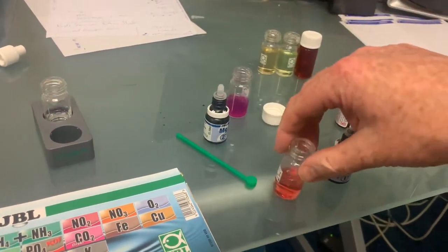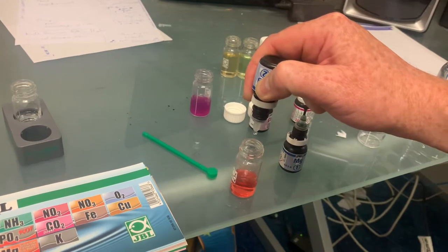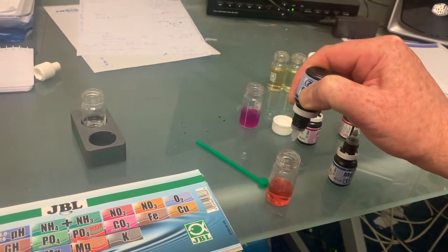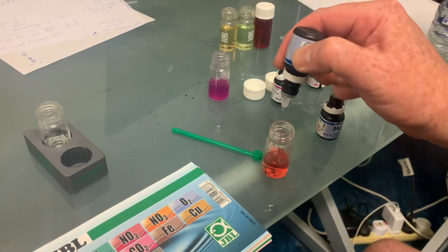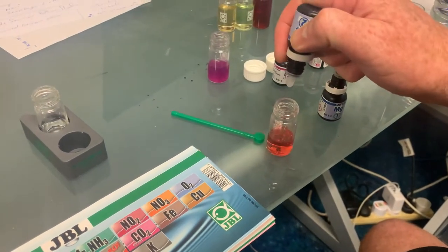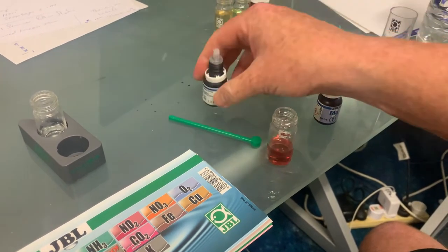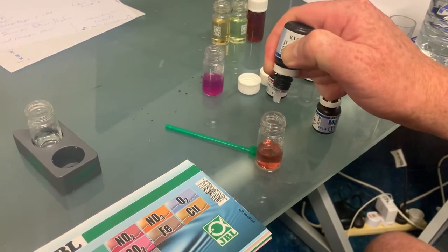Adding one drop at a time: one, two — you should do one drop at a time. Three, four — once again, one drop at a time. Five, six — when you're doing it with two hands it's much better. Seven. Eight. Nine. When you use two hands you can make sure the right drops go in and you don't get little dummy drops. Ten.